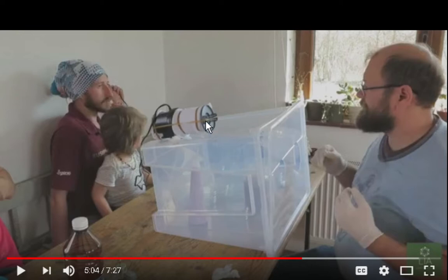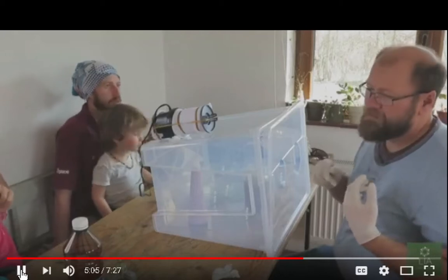What would be even more interesting is if I had a pump set up to run air through a tube, where I don't have to listen to this pump, and just run the tube into a filter setup, and that filter setup has to be like down to 0.2 microns or something. I could do something like that. I could have an enclosure outside. Maybe, I don't know. I think it's a good idea. I have to listen to that noise.